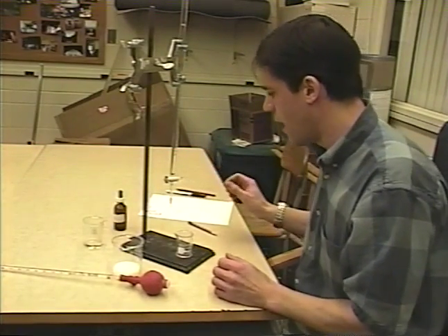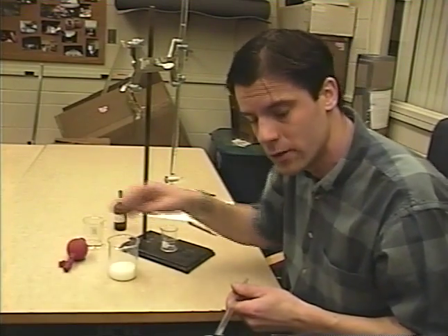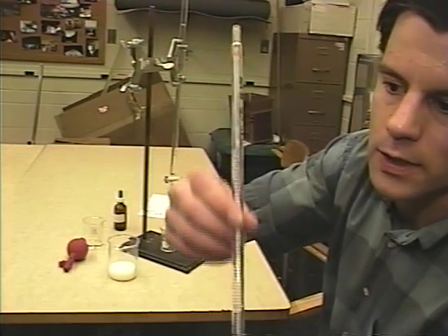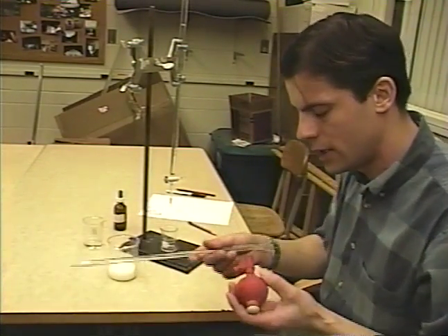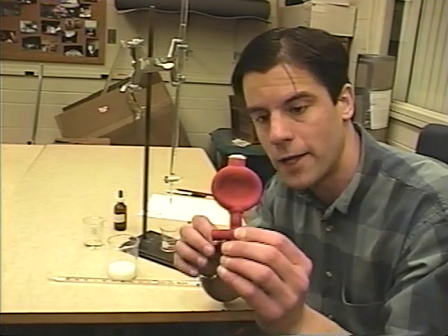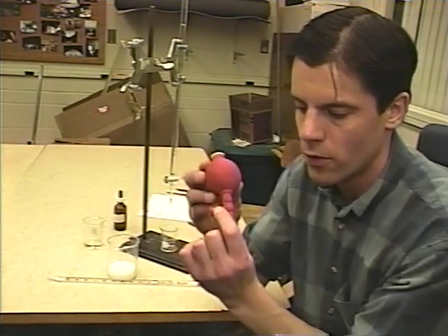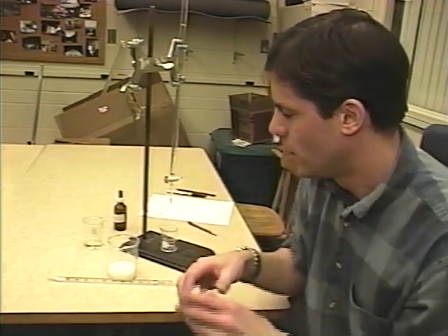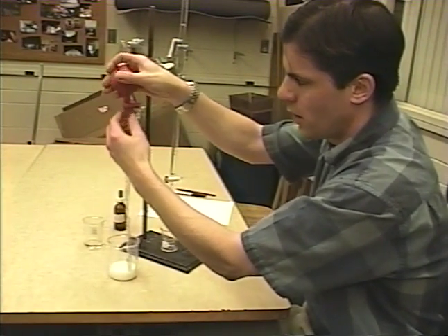Now, how to do this — in this case we're doing it with milk, so you want to use the pipette to measure out 10.00 milliliters of milk. These pipettes are calibrated, as you can see here, to milliliters — actually to the hundredths of a milliliter. What you need to do in order to get any solution into this pipette is use a pipette bulb. There are red ones and black ones, but they essentially work the same. The red ones work by squeezing the bulb to begin with; there's a one-way valve that creates a little vacuum. Squeezing the arrow will draw solution up into the pipette, and squeezing the other arrow will let the solution drain out. Just to show you, I'll put it on the pipette and put it in our milk supply and squeeze the bulb — you can see a little milk getting drawn up.